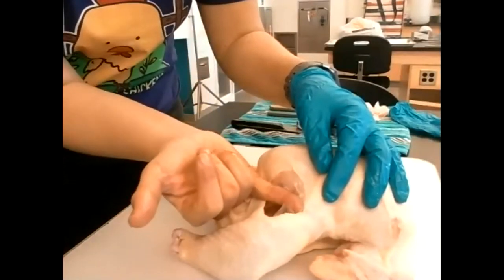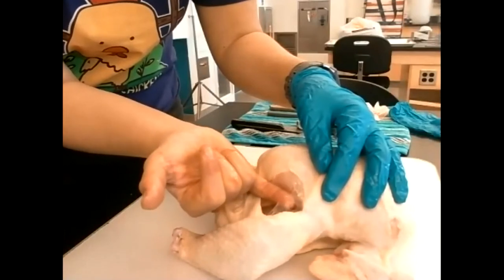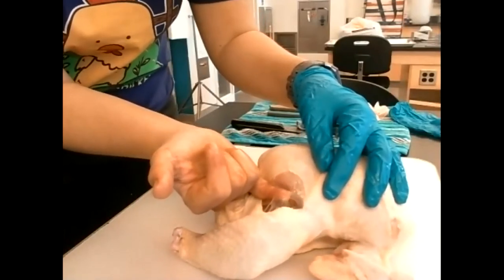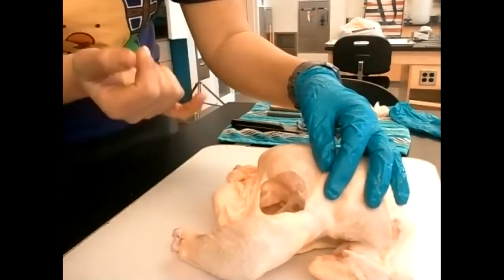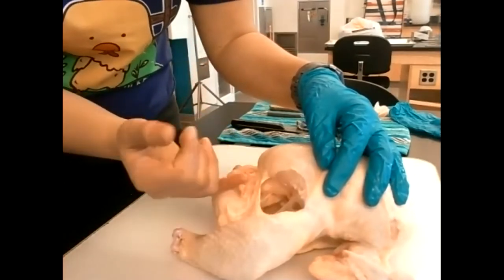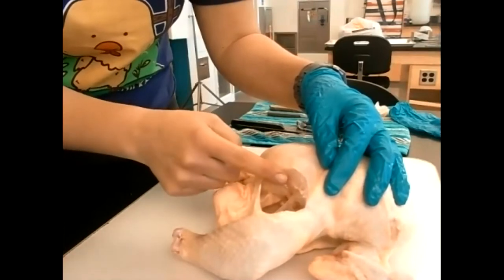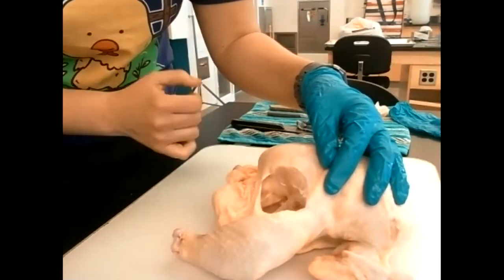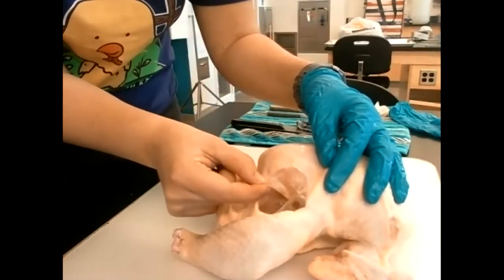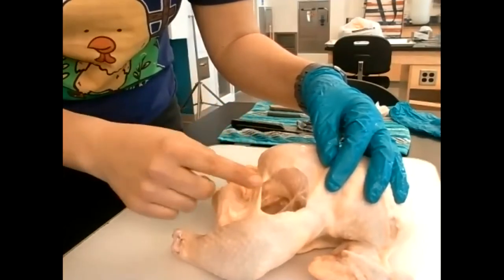This slimy, clear tissue is called fascia — it's essentially equivalent to your hypodermis, securing the skin to the underlying muscle tissue. There's a lot of it that you're going to be cutting through with your knife.